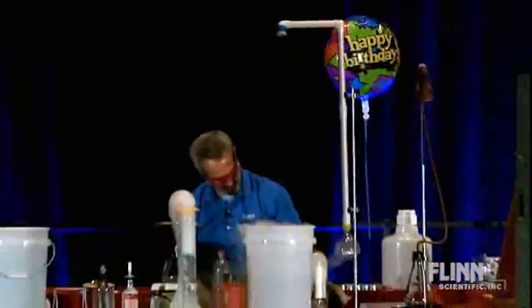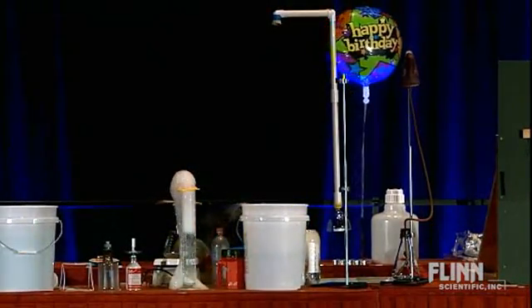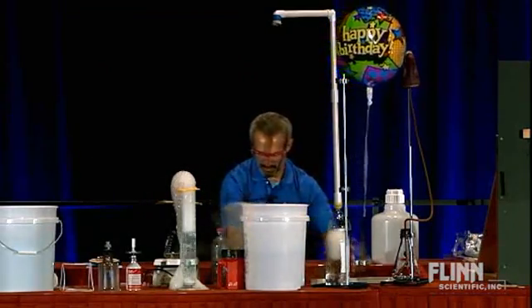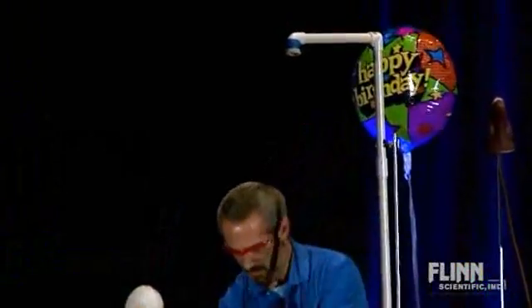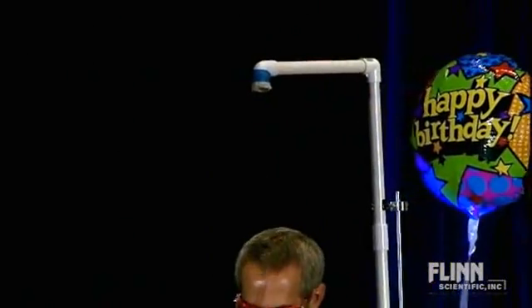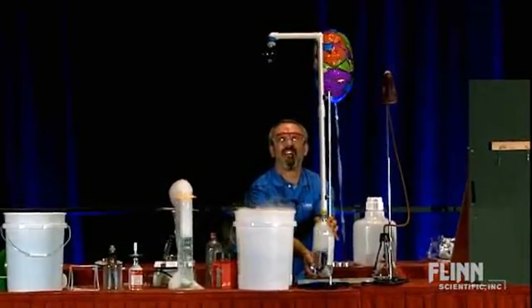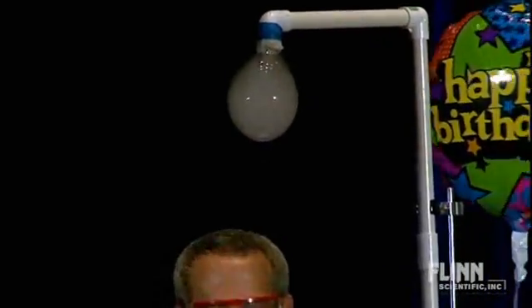Maybe I'm going to put one more in there. This time I'm going to put a soap film across the top up here. That's the one I use for the magnesium — this will be better. I think I got one across there. Now that's the air that was in the tube. Now watch this first part that comes through — there's the CO2. Look how dense it is, weighing that bubble down.